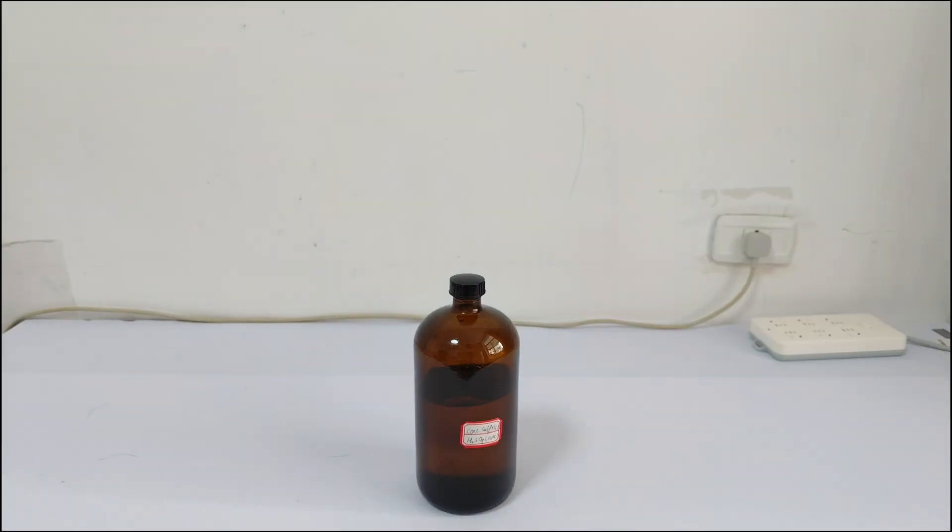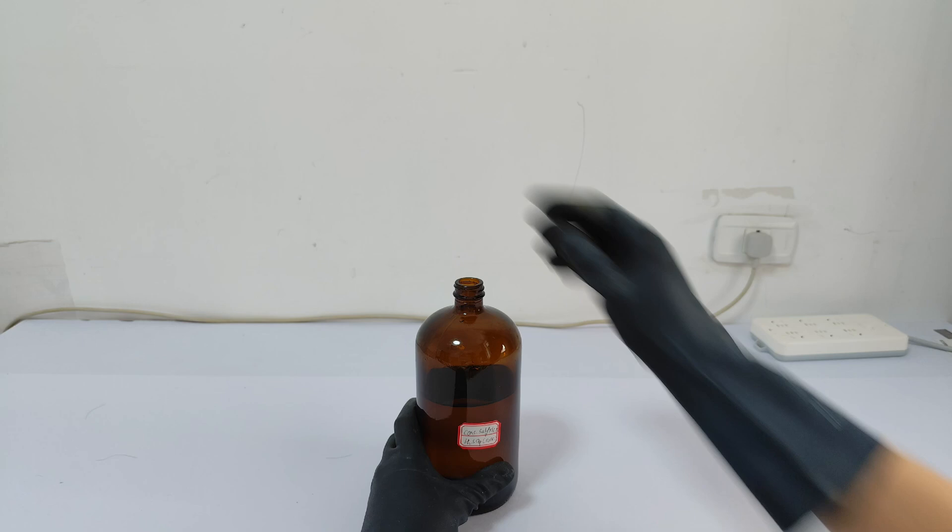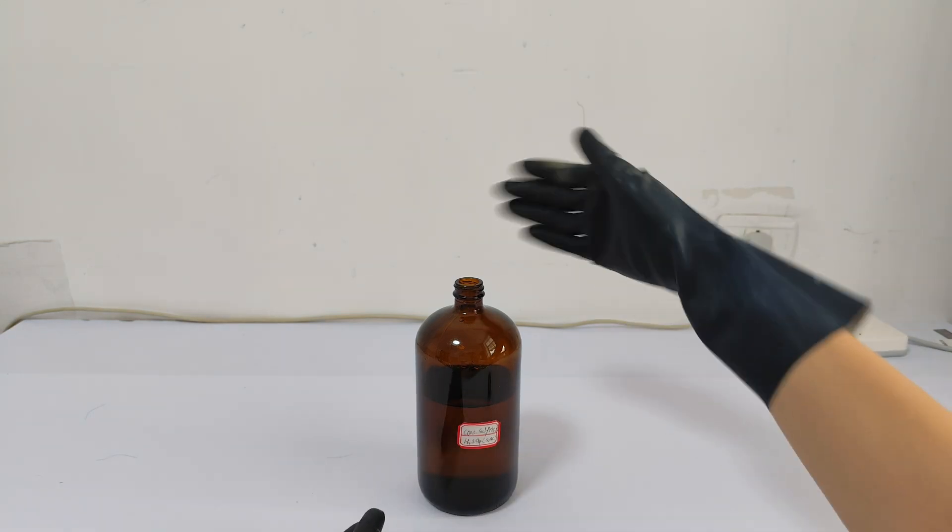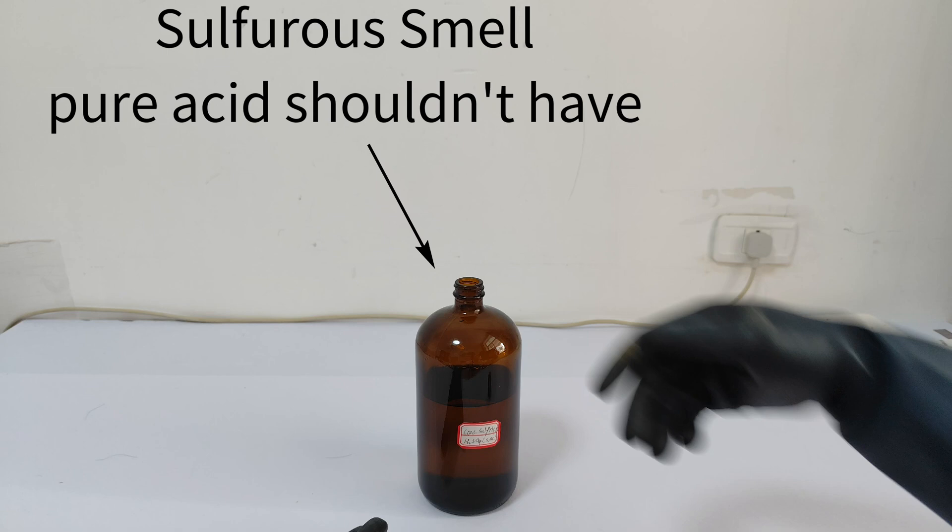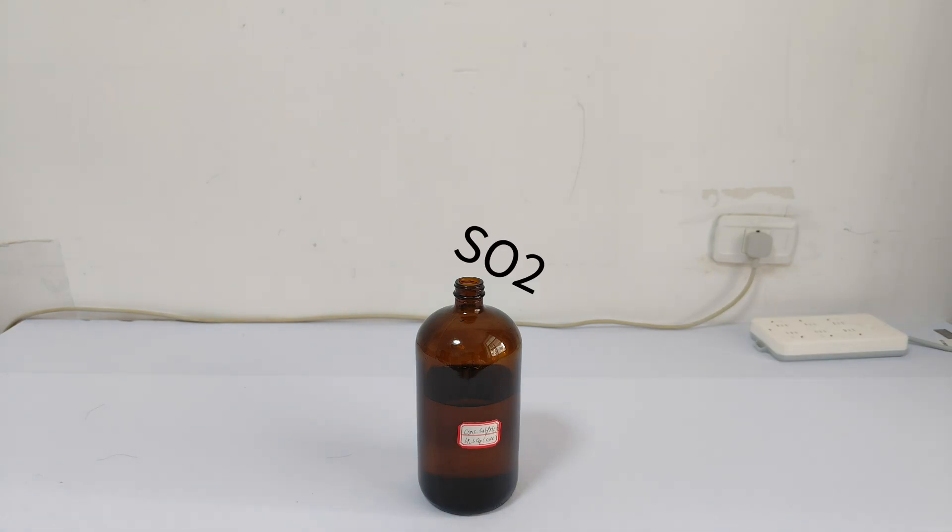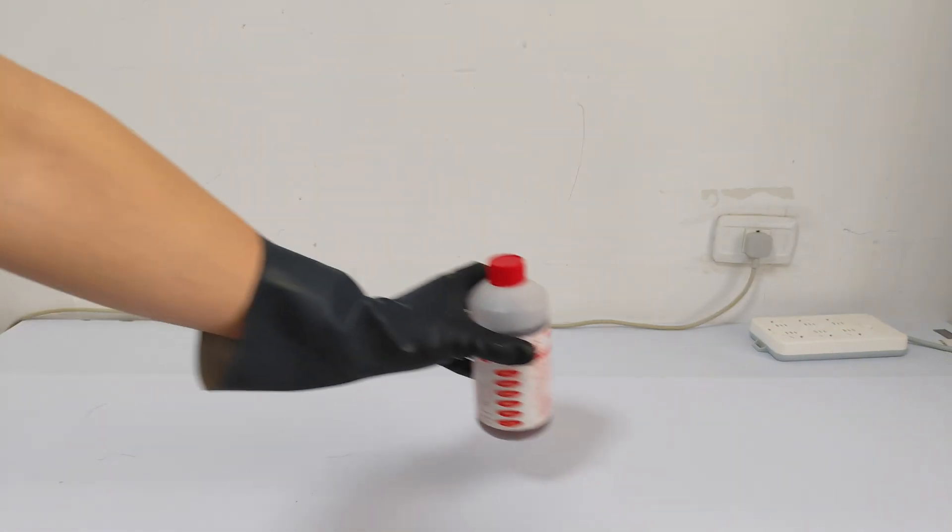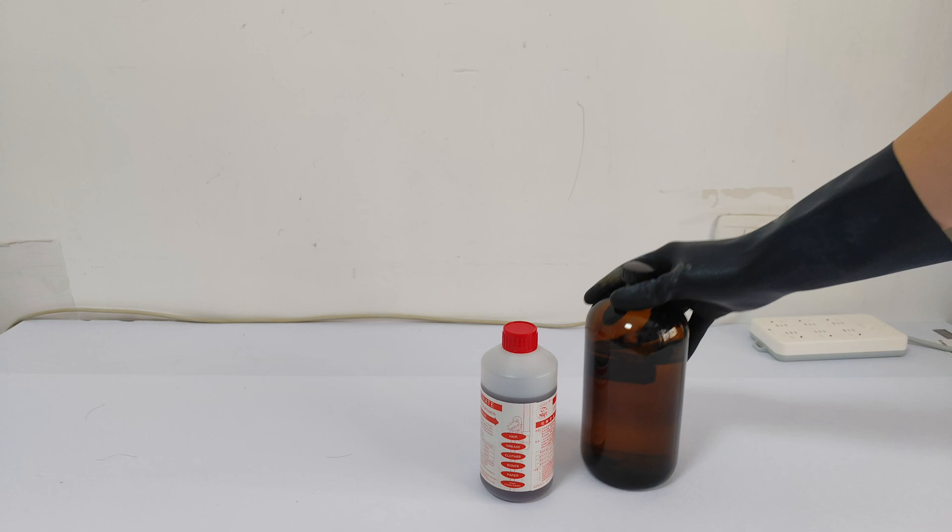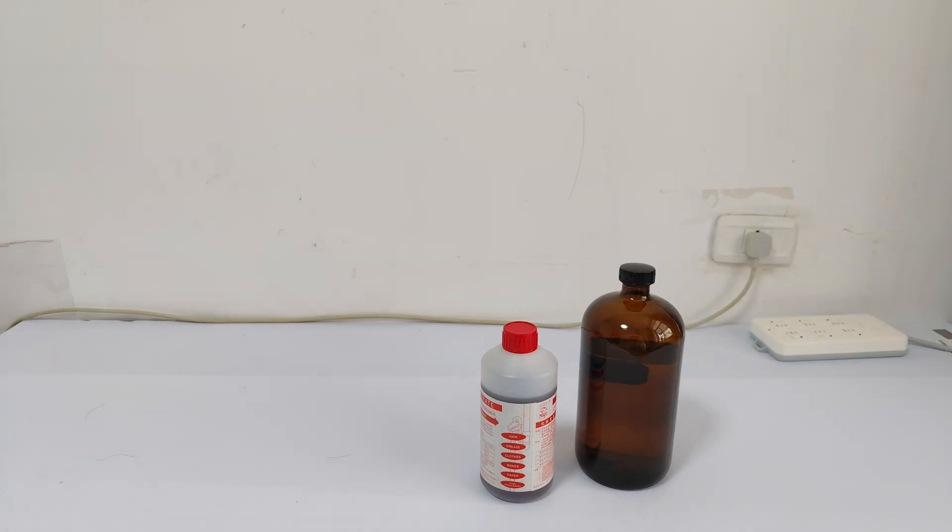A few weeks ago, I made some sulfuric acid from drain cleaner. But I was disappointed because the acid emitted a sulfur smell, which pure sulfuric acid shouldn't have. That probably means some SO2 is in the acid. So today, what I'm going to do is make some pure sulfuric acid without any smell.